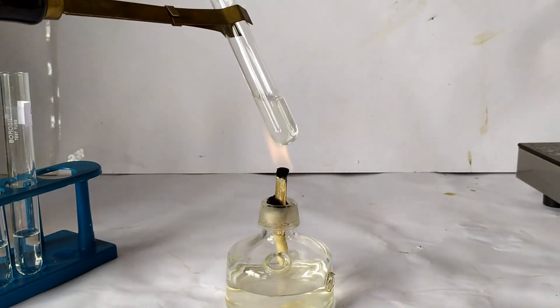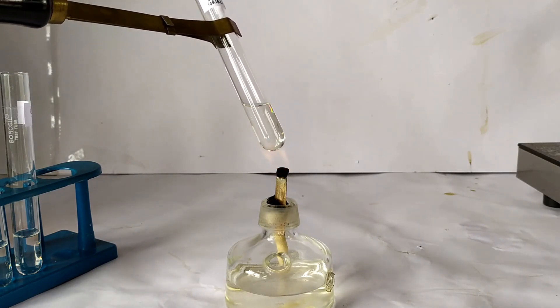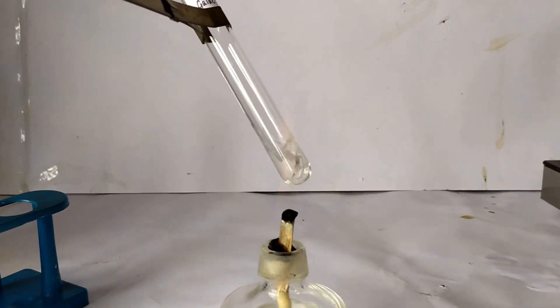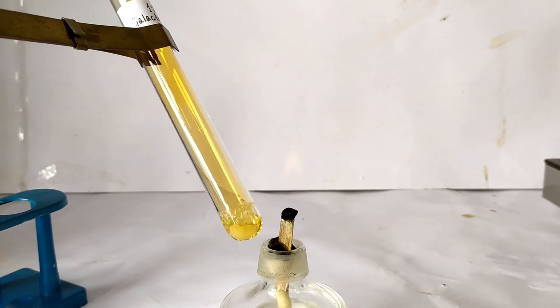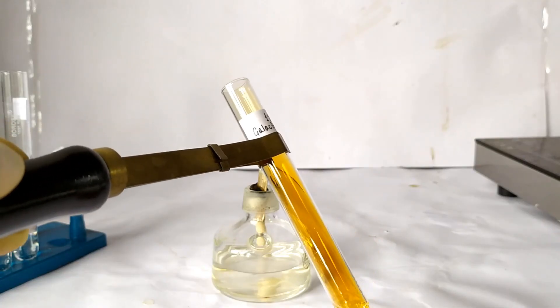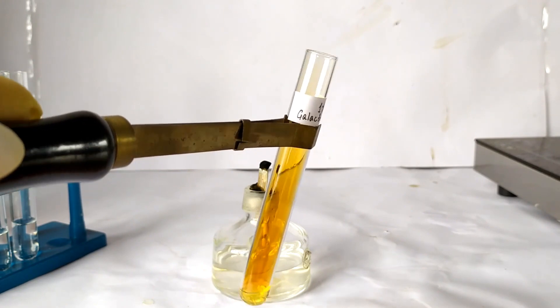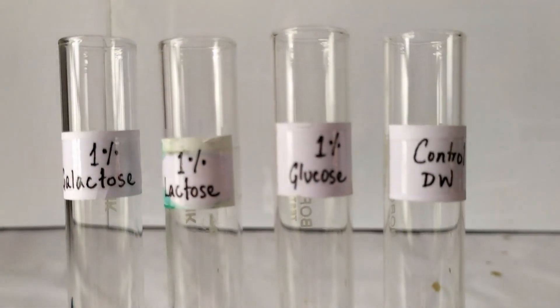Boil the test tubes in a well-ventilated area or under a fume hood until the volume of the contents in each tube has reduced to about 1 ml. You can also leave the tubes in a boiling water bath. During this time, brown fumes of nitrogen dioxide can be seen emanating from each tube. The fumes are toxic and should not be inhaled. Once the volume in each tube has evaporated to about 1 ml, remove the tubes from the water bath or from the flame and allow them to cool and remain at room temperature overnight.